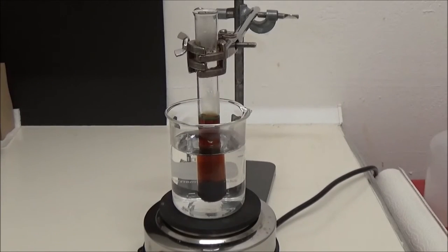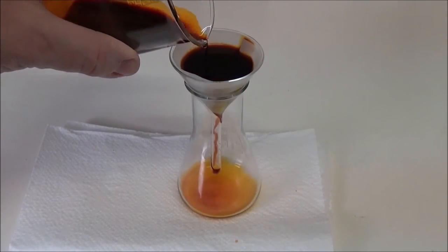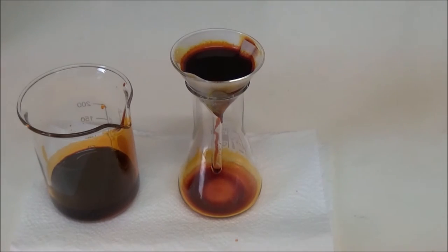After the melt has largely cooled, the test tube was filled halfway with diluted sodium hydroxide solution and heated in a water bath to dissolve the melt. A glass rod was subsequently used to help with this and, after decanting the solution, the remainder of the melt was completely dissolved with more sodium hydroxide solution. The water-soluble sodium salt of fluorescein is formed. The collected and cooled solution is then separated from unreacted insolubles by gravity filtration.